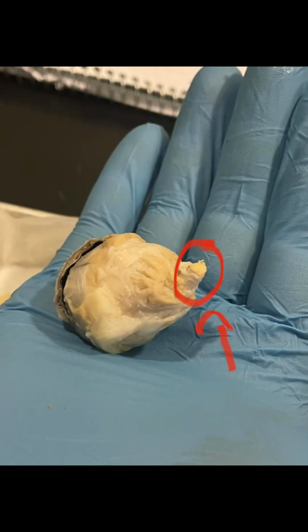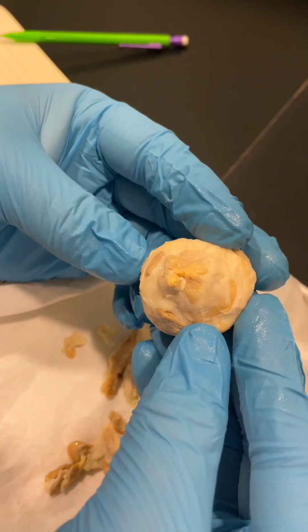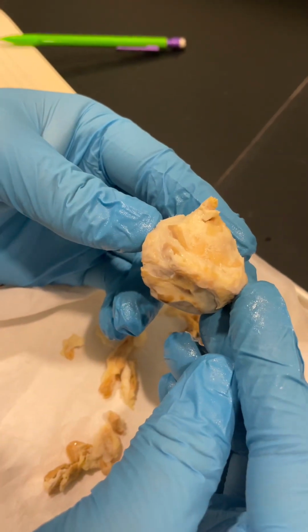In the picture demonstrating here, we will be showing the optic nerve. The optic nerve is composed of millions of nerve fibers that send visual messages to your brain to help you see. You have an optic nerve at the back of each eye that connects directly to your brain. The optic nerve transmits electrical impulses from your eyes to your brain. Your brain processes this sensory information so that you can see. Okay, so right here is the optic nerve. Where should it go?